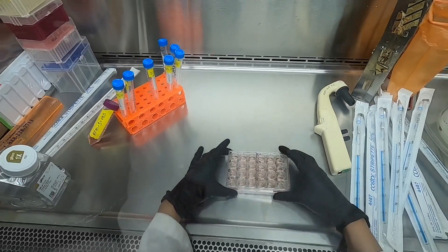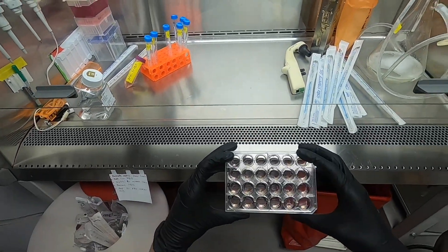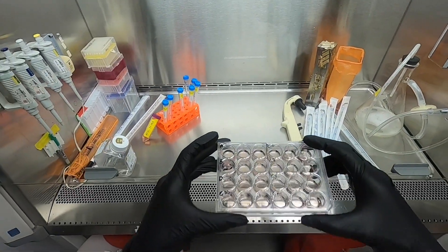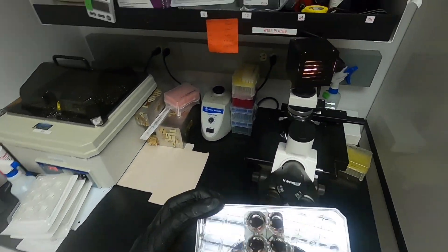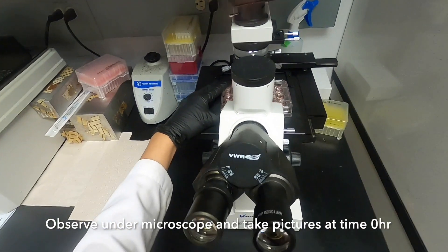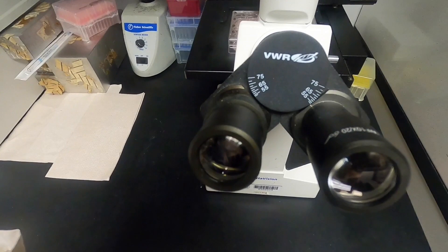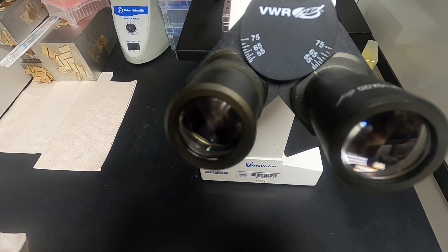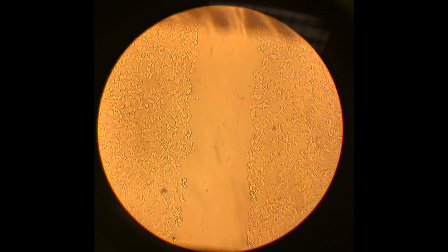Once we have added all treatments, we are ready to visualize our wounds. We can take pictures of this time point, which will be considered time point zero. Now it is your turn to assess whether or not capsaicin has any effect on cell migration and at which concentrations.